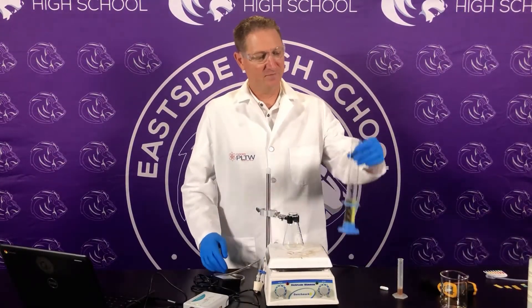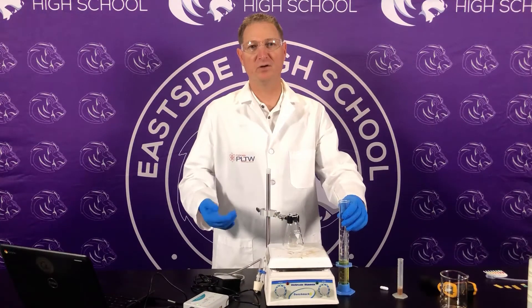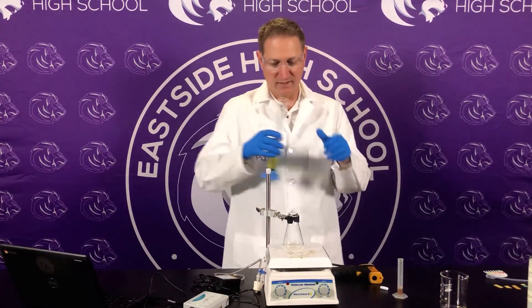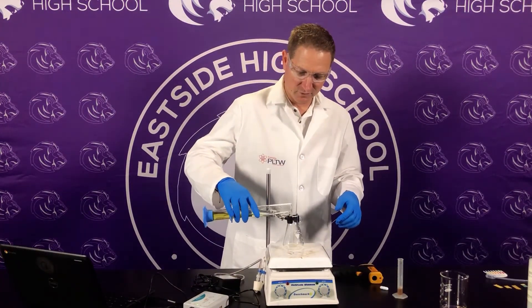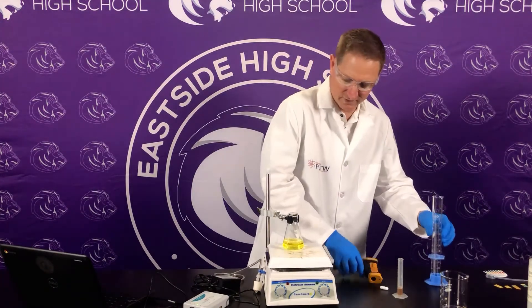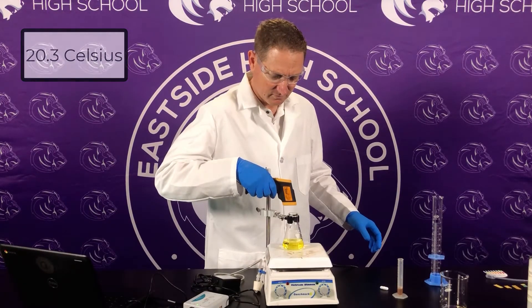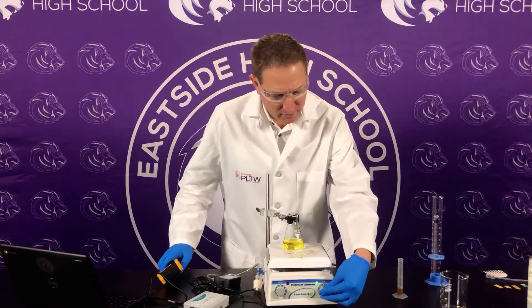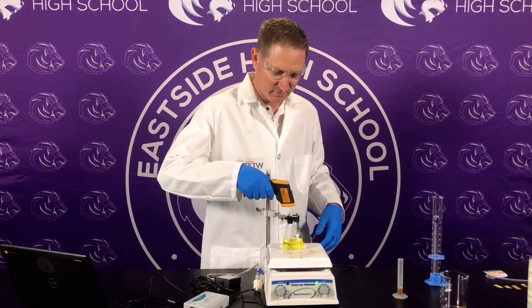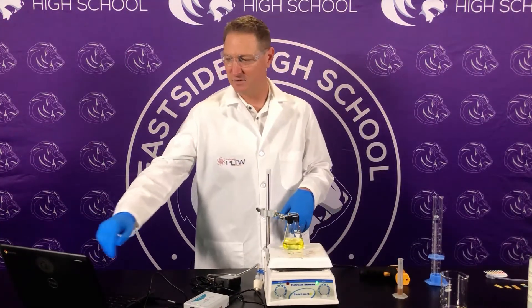Now we're going to use pH 11. We took the hydrogen peroxide and made it pH 11 — we added some sodium hydroxide, 0.5 molar, about 4 milliliters, to get it to that pH. We did take the temperature last time. We're going to put 50 mls in here and take the temperature. Temperature last time was 20.3. Let's turn it on — same setting of 5 — mix it up. Temperature is again 20.3.